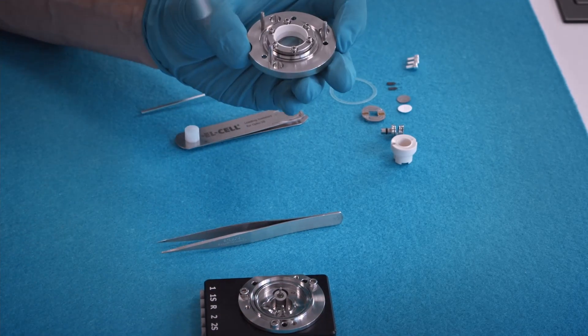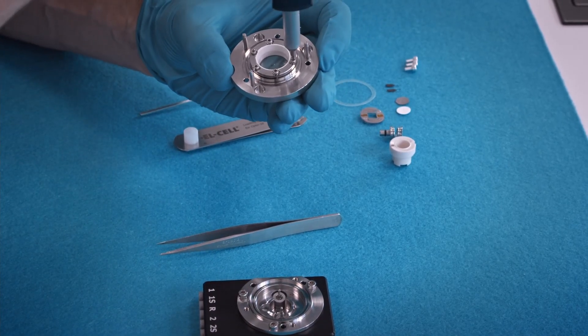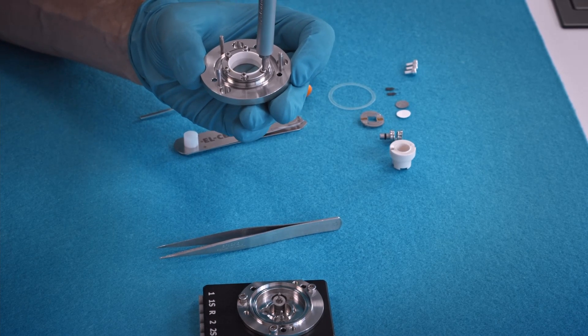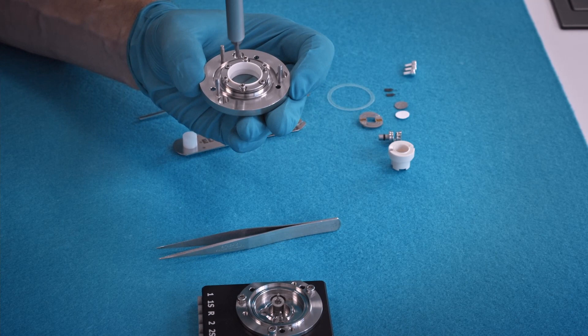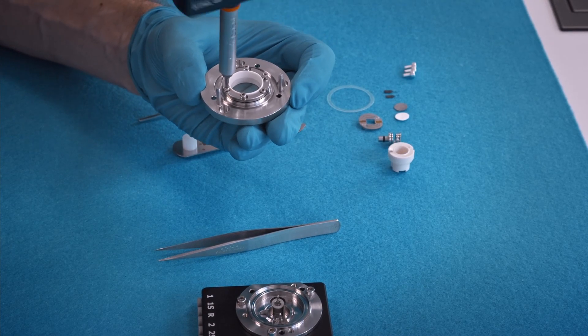Using the provided torque wrench, we screw in the screws, first gently, only gently, one after the other.